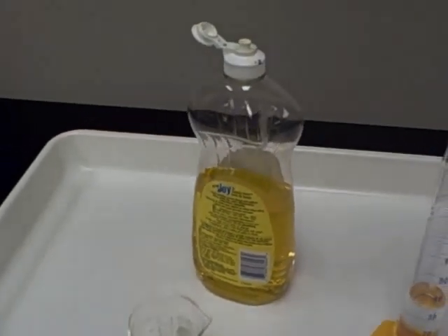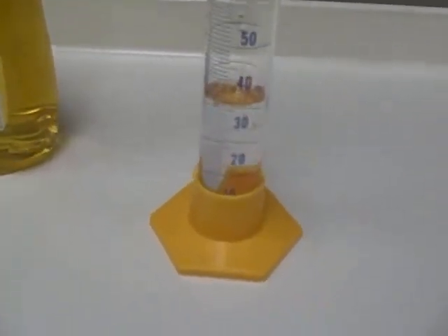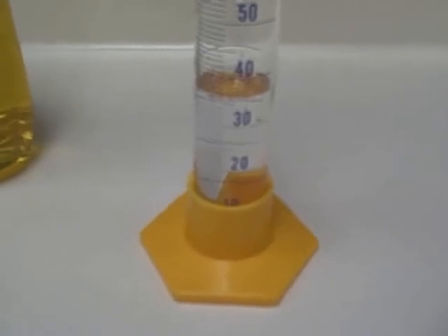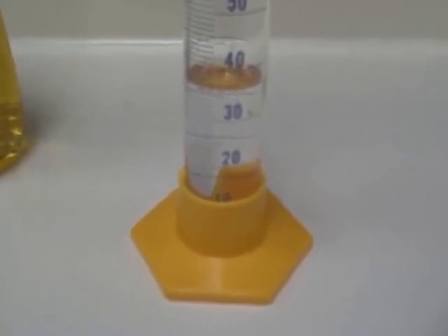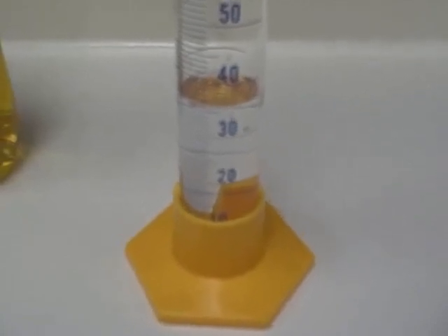We're also going to add a little bit of dish soap to our hydrogen peroxide. And the reason for that is, if one of the products of hydrogen peroxide's decomposition is oxygen, we'd like to be able to try and capture that gas so that we can test to verify that indeed that is the reaction that's occurring.